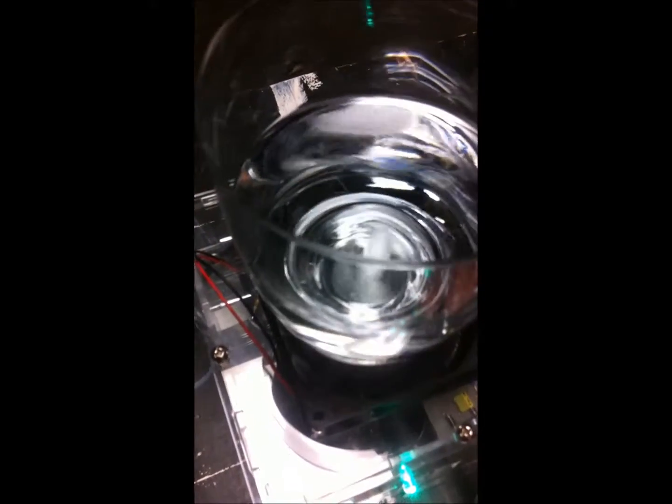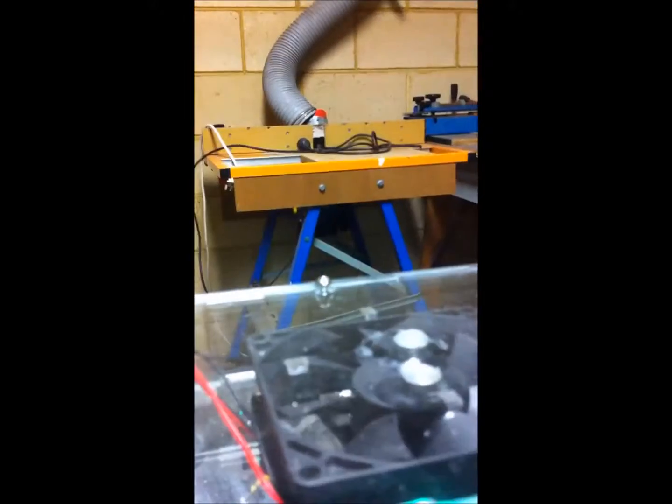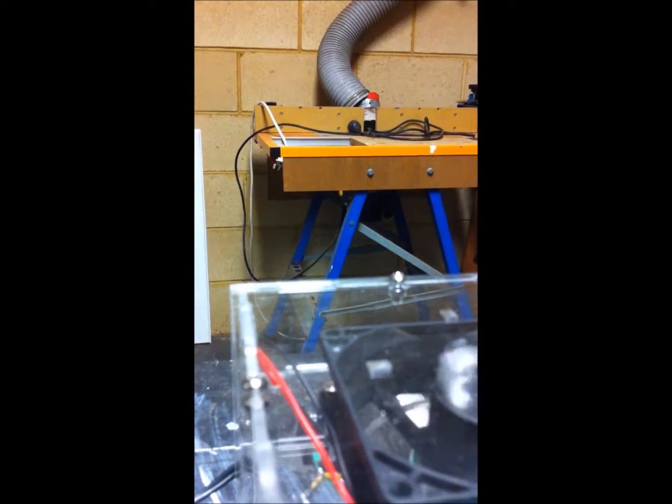Now, this pulse width will go quite slow, even though this isn't a beaker designed for it. You can actually get it down to, that's a bit too slow for my liking, come on. I'll just start our friend up again. Need to pull this one off so that it will go. And we can get it a little slow if we're gentle. This isn't an ideal shaped vessel, at the bottom it's got a dip on it which makes it lift.